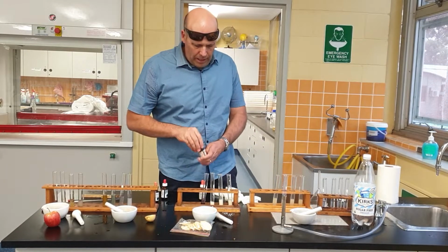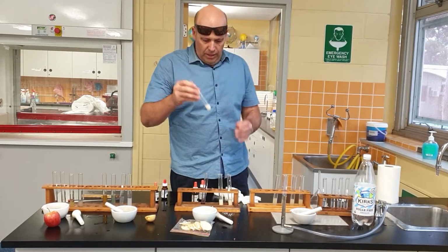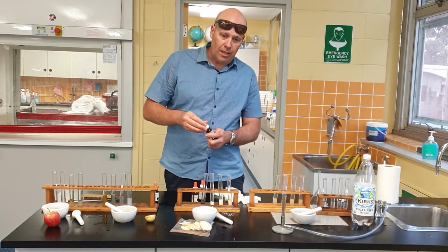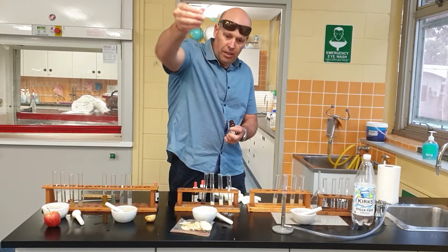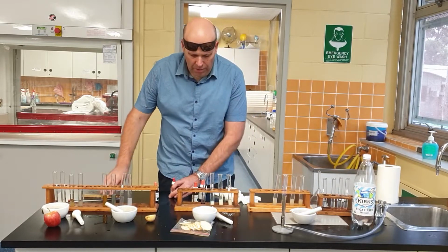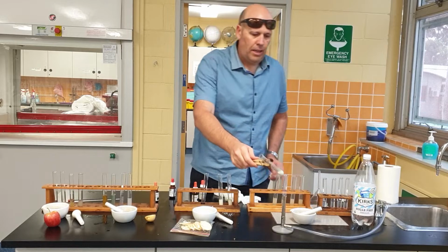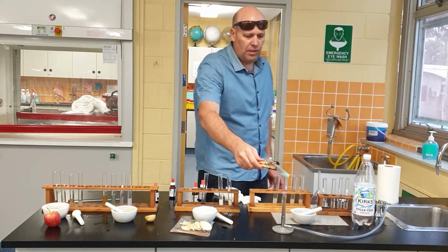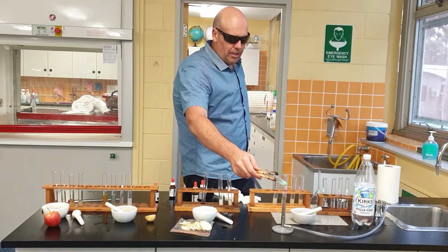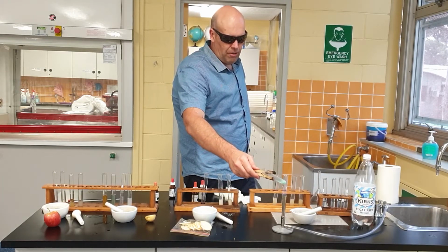Next one, what's our next test? It's glucose, isn't it? So what do I need? I need the big B. I need the Benedict's. So I'm going to put some Benedict's in. I'm going to give it a bit of heat. And let's just see what we got. So we're testing to see whether there's glucose sugars in here. Okay, I'll put my glasses on. Alright, so I think, is there any sugars in here? What do you reckon?